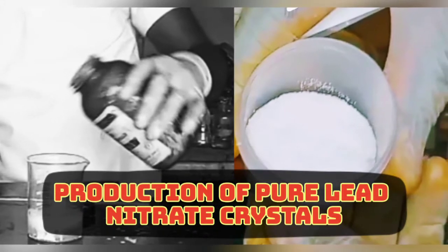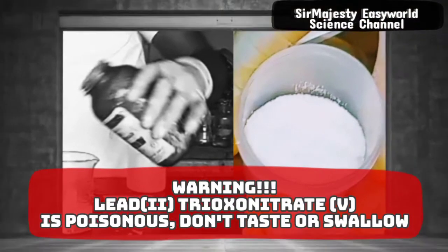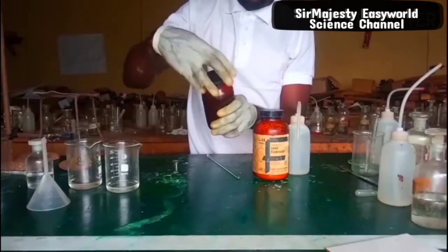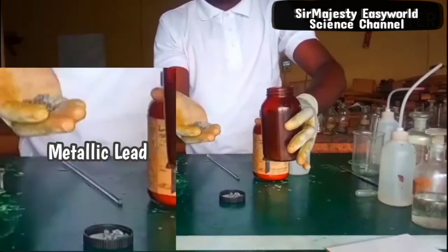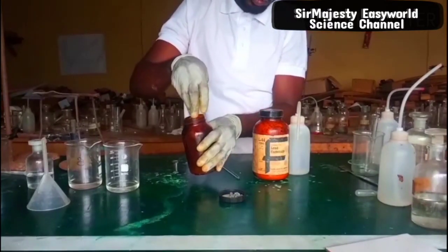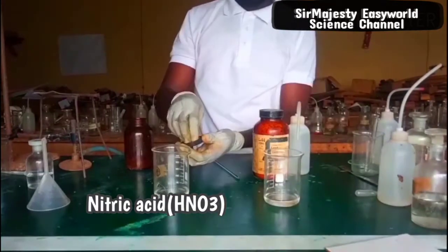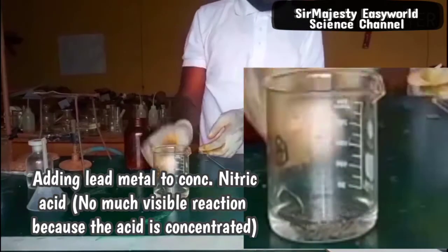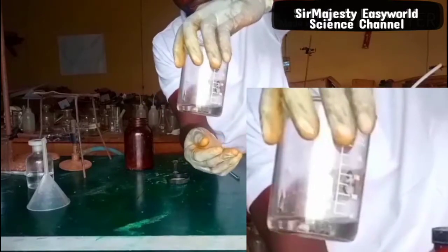To synthesize pure lead nitrate crystals, you need to react either lead carbonate, lead metal, or lead oxide with nitric acid — concentrated or dilute depending on the method. This is the lead metal. When reacting lead metal with nitric acid, we need to dilute the nitric acid. The reaction between nitric acid and lead metal is shown on screen. There won't be any visible reaction if the nitric acid is concentrated, as you can see — there is not much reaction taking place.